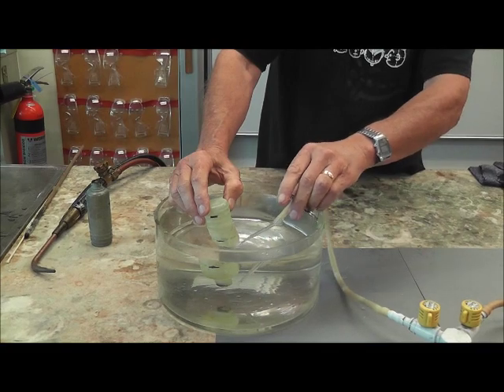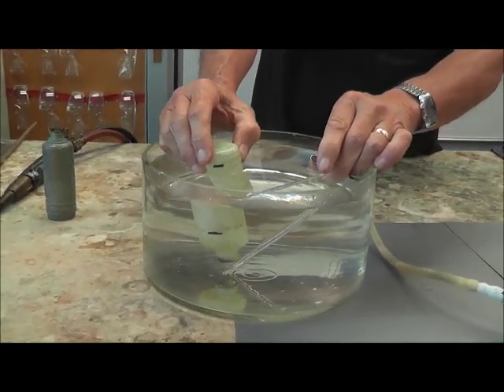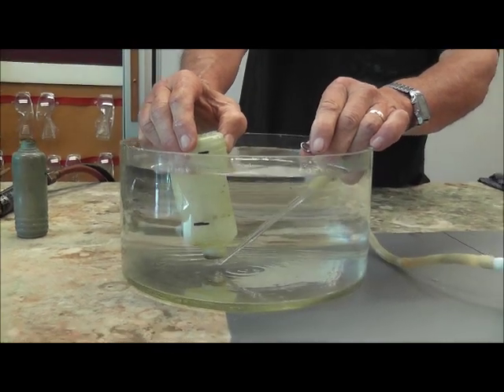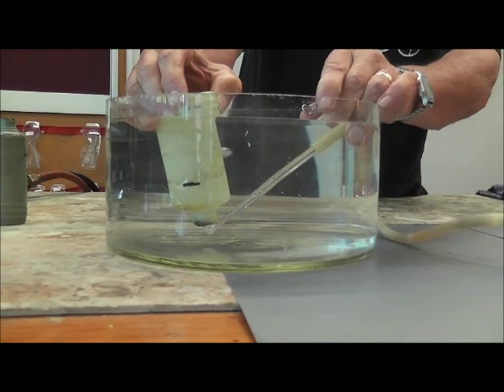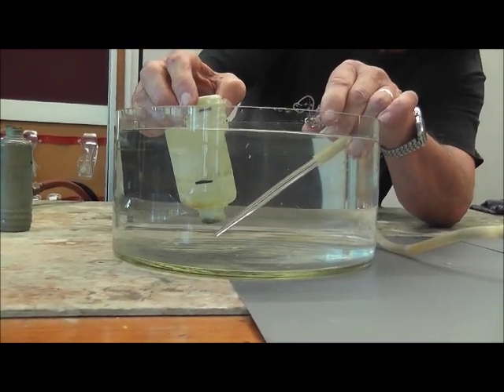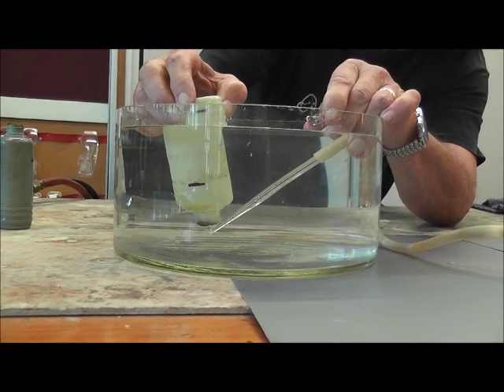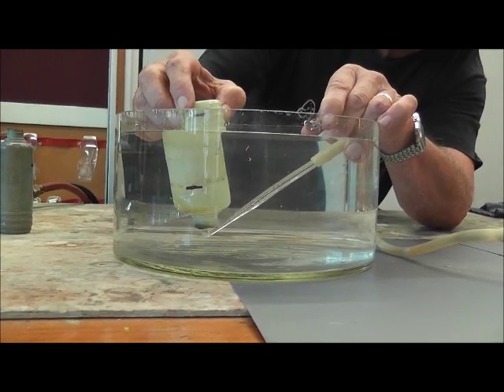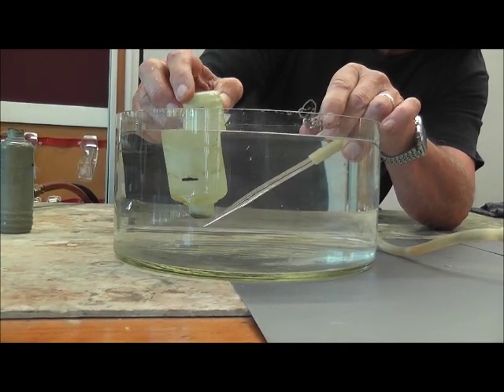Okay, in the same way as before we are now going to put in propane. But this time we will only half fill the bottle with propane, because the equation says that we should have propane and oxygen. So we've got propane in there, and we'll go down to about half way. And that's looking a little bit like half way, maybe a smidgen more.